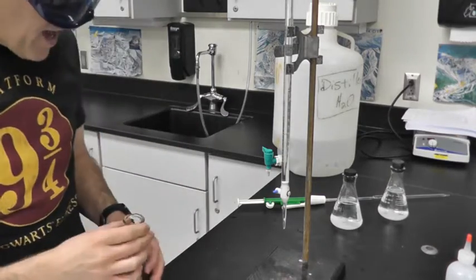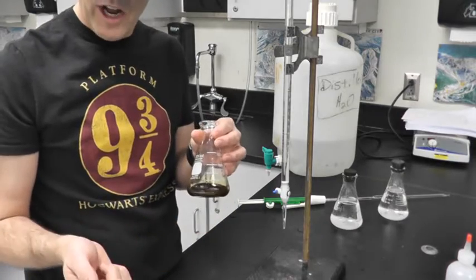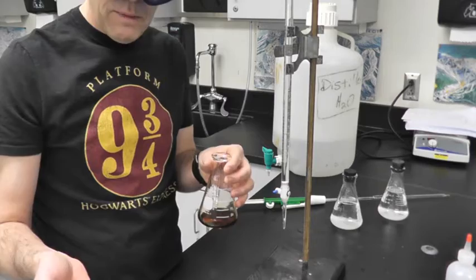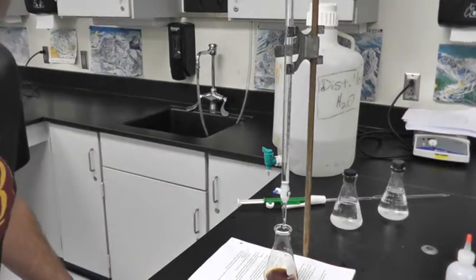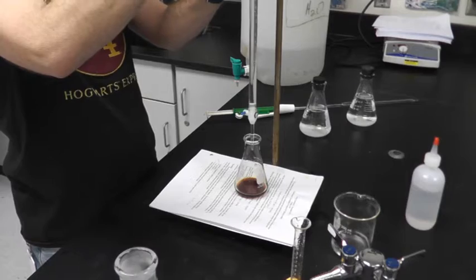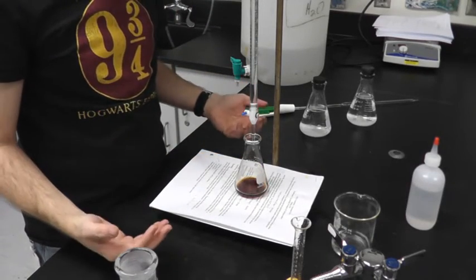Okay, so what's going to happen is, in a typical acid-base titration, we're looking for a color change. We typically add phenolphthalein, which is pink in bases and clear in acids. So I'm going to go ahead and start titrating. I'll move this, let's see the color. But what's going to happen is this reddish brown liquid is going to go to a reddish liquid. It'll go to orange, then it's going to get to yellow.